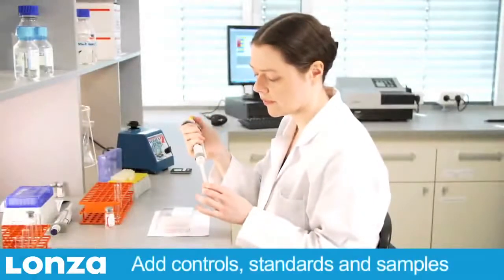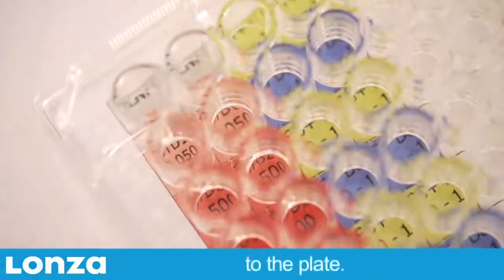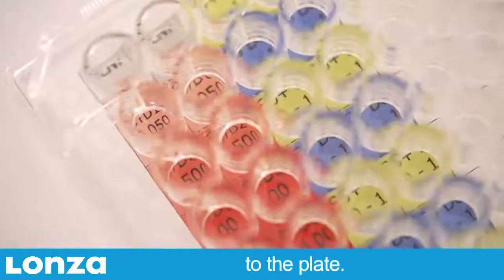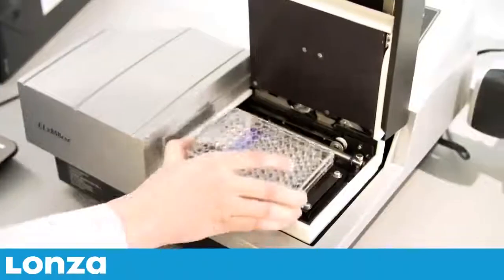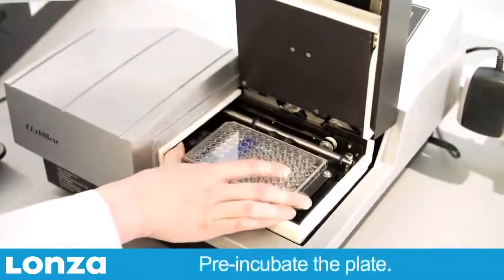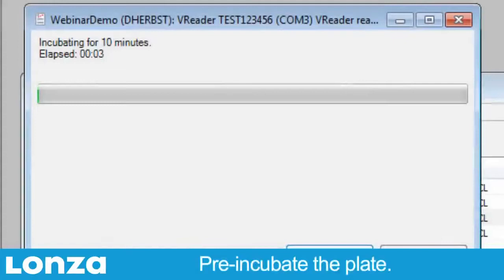Add controls, standards and samples to the microplate. Pre-incubate the plate for at least 10 minutes at 37 degrees Celsius.